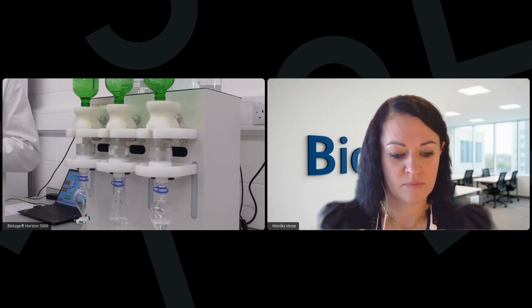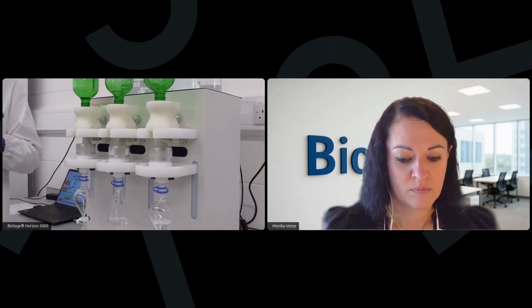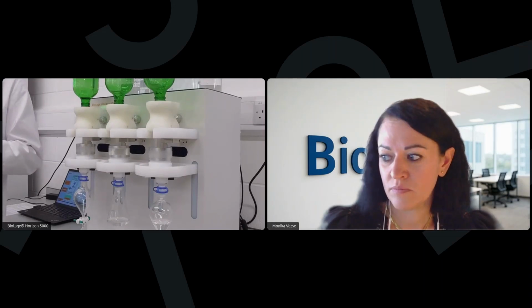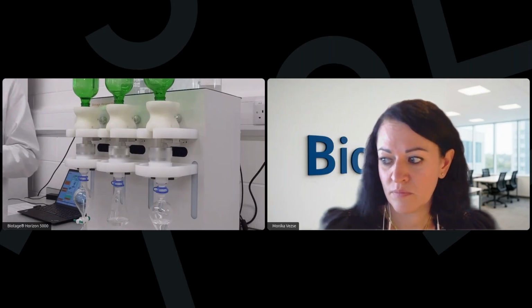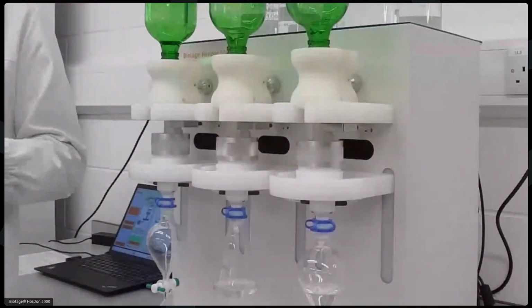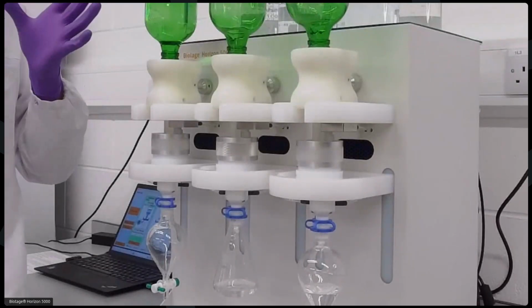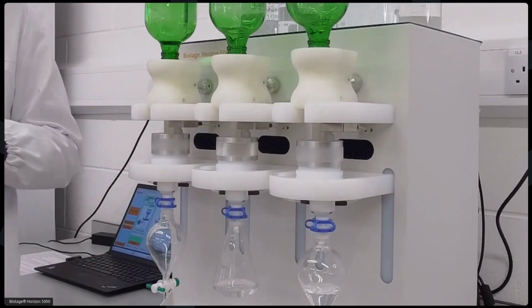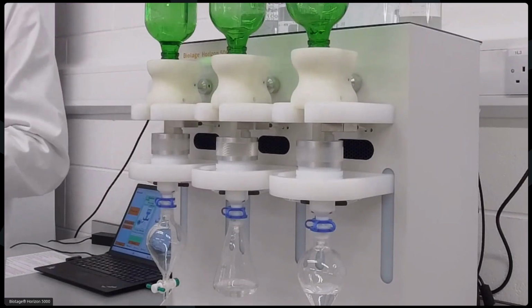And so yes, all you have to do is, as mentioned earlier, layer the disc, or on top of the disc rather, with pre-filters, diatomaceous earth if you have really small particles in there, as well as quartz wool, and this will allow you to properly process a sample without clogging of the disc. The system also allows bottle rinsing, so anything that's left on the bottle, you will be able to rinse the original sample bottle, which is again a requirement in plenty of methods, and then elute using the rinse aid.